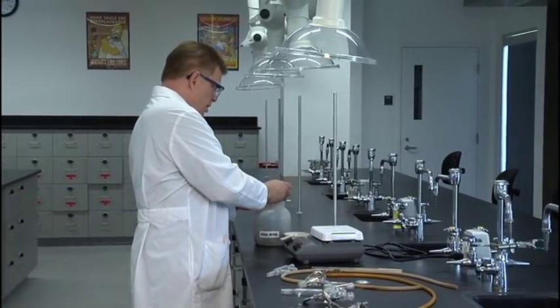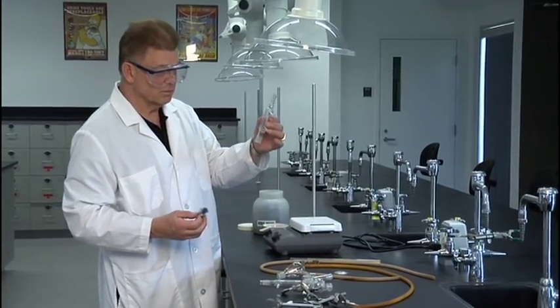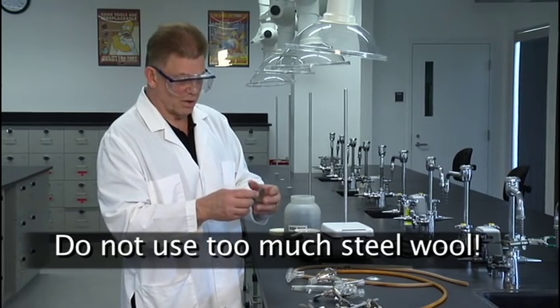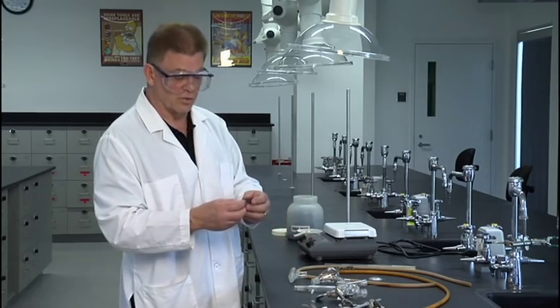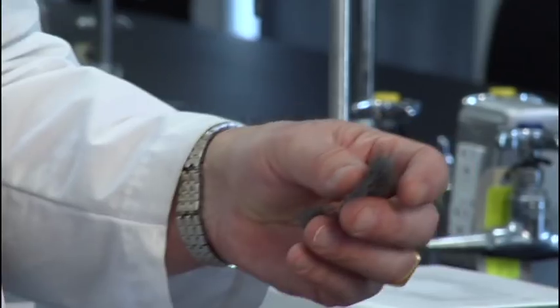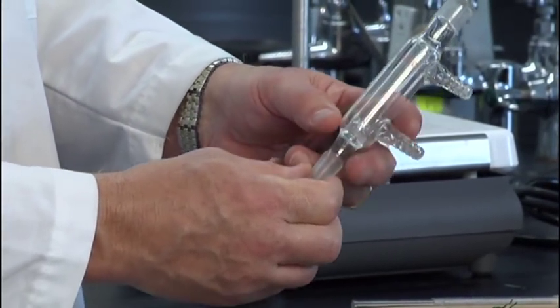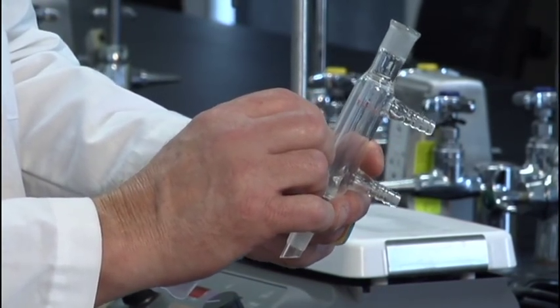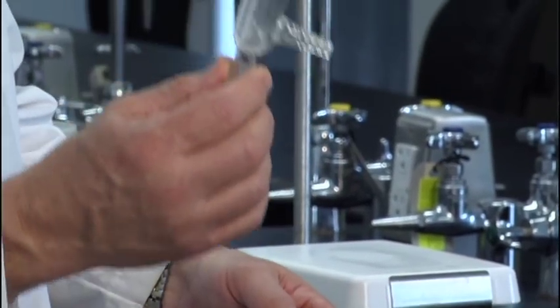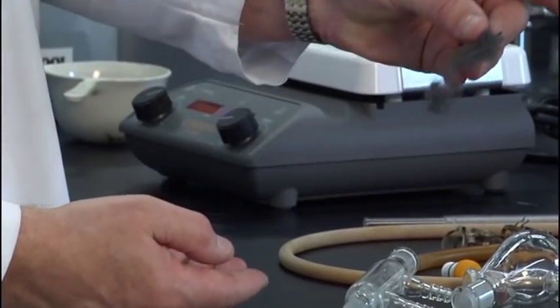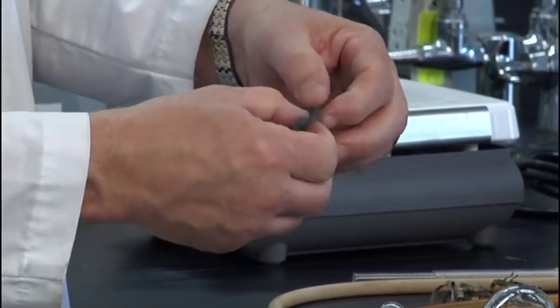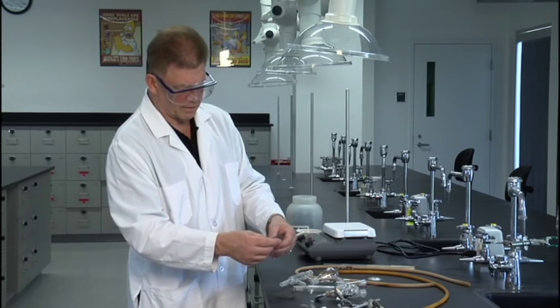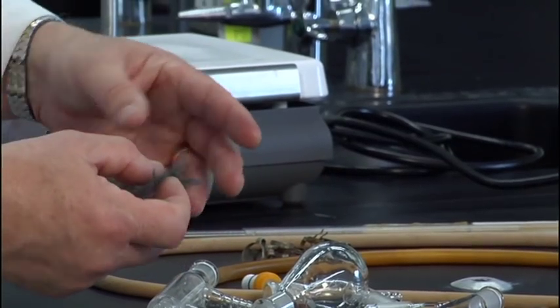And a lot of surface area provides a place for the condensate to re-evaporate. And so chemical engineers call this having a lot of theoretical plates in a distillation column. The more theoretical plates, the more efficient the fractional distillation. So there's all kinds of designs for distillation columns. There's all kinds of three-dimensional packings, rings and spheres and things like that that they put in here to provide this surface area for the vapor and condensate to mix. But we're going to go with steel wool. That's what we have and it's cheap and easy. And so we have a jar of steel wool. So we're going to take a little steel wool out of the jar and we're going to pack our short fat condenser with some steel wool. Now the most common mistake when you get to this point is using way too much steel wool. So because it doesn't look like much in your hand, but when it gets in that little tube, you'll be surprised how much it is.